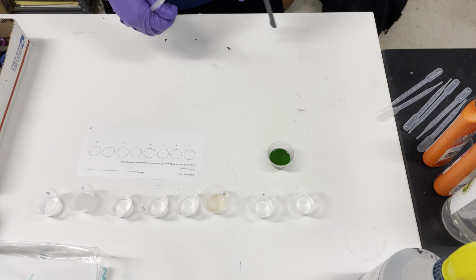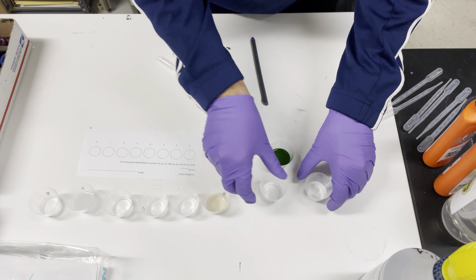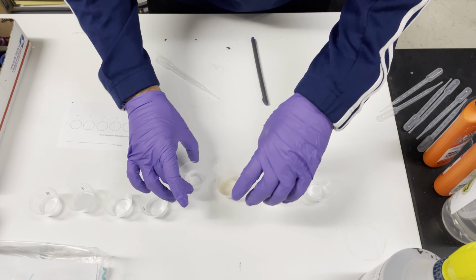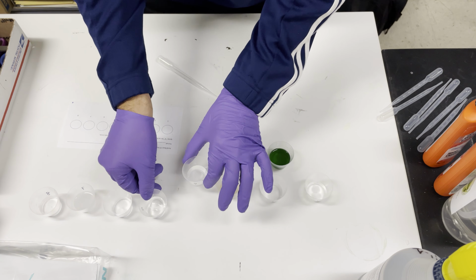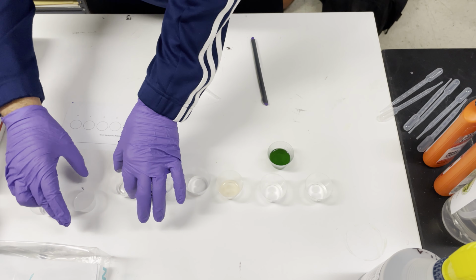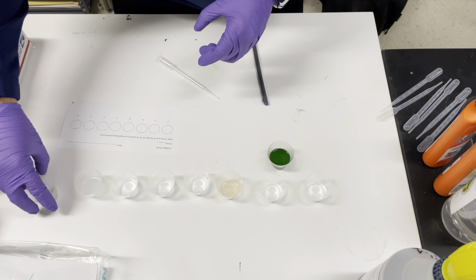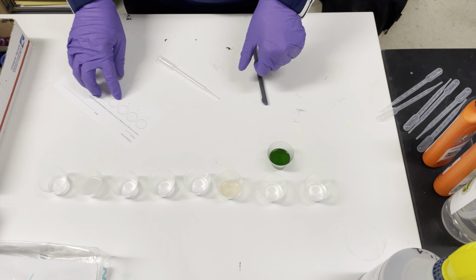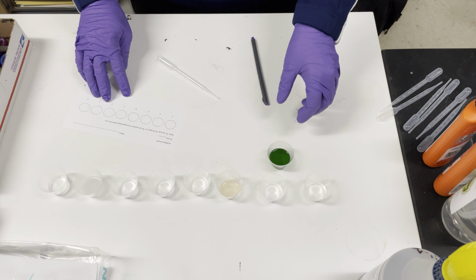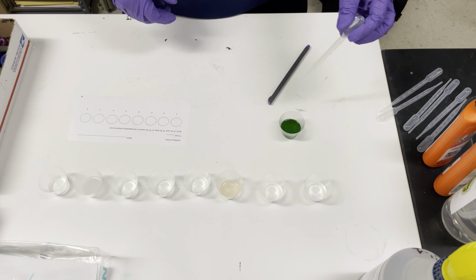This is the acid-base ID test. They get cups numbered 1, 2, 3, 4, 5, 6, 7, and 8. They get a little test piece of paper that's asking whether they are acids or bases.